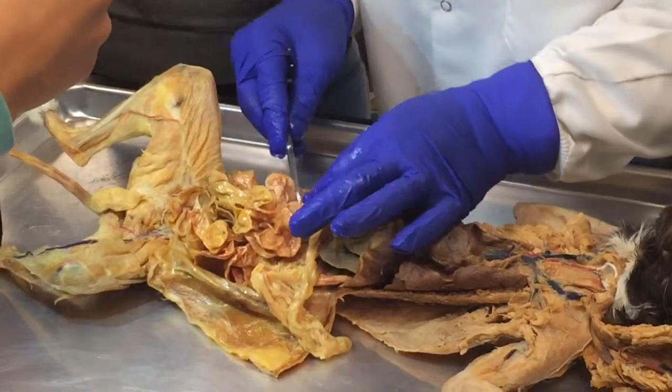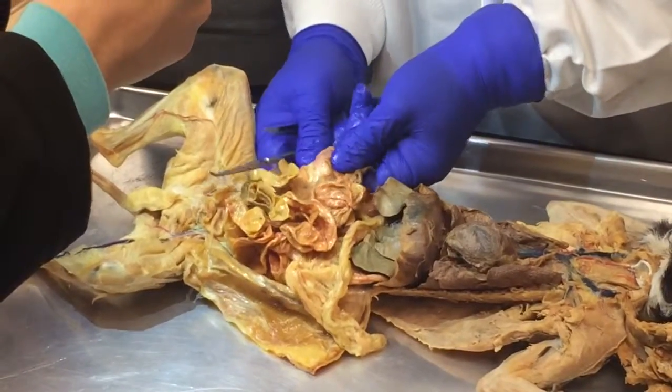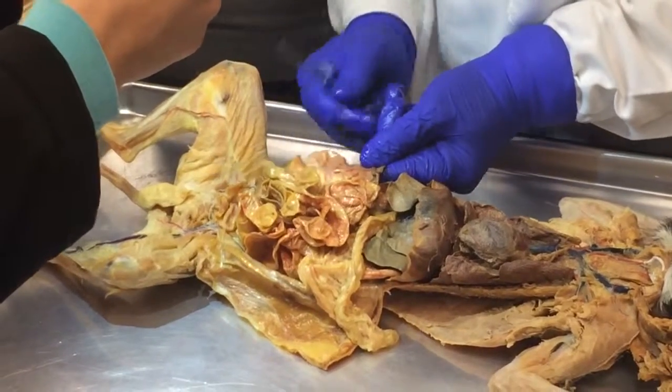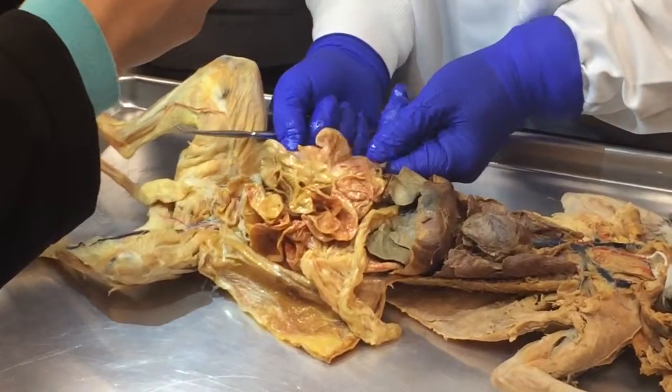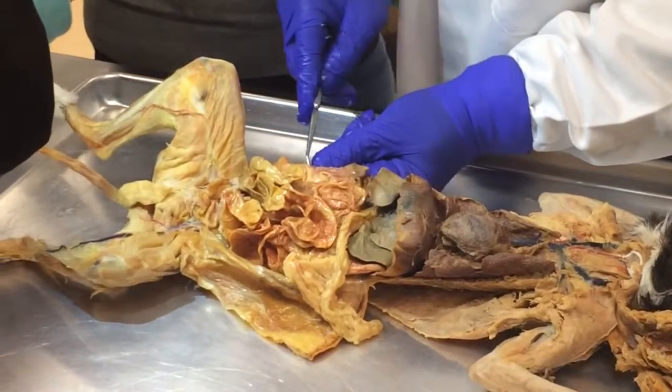Okay, you see how fair it is? Now I see it. All right, this is the colon. It's just that mine was bent here, so I'm trying to straighten it up. But you see how thick it is? Yeah, I see it now. And you see this one, and you see the junction. You can even see the junction. Yeah, now I can see it.